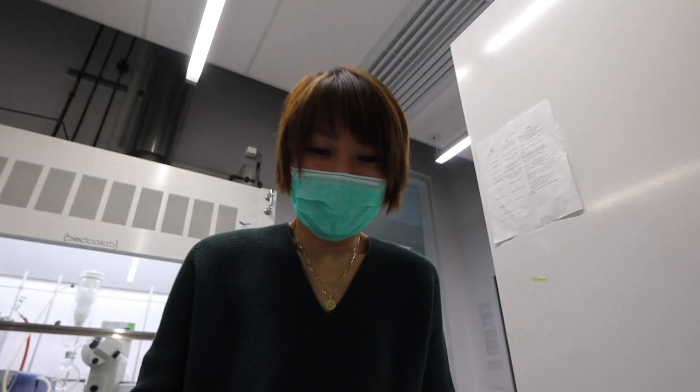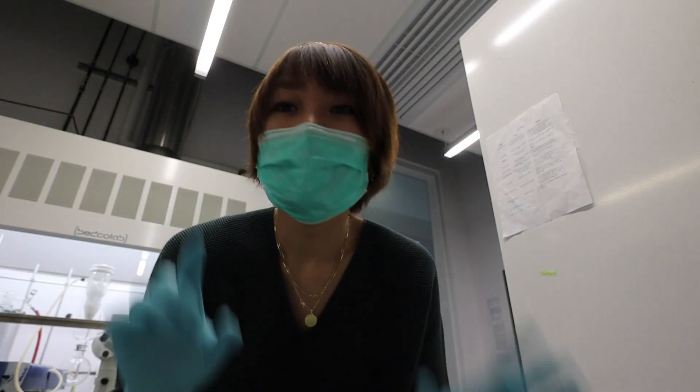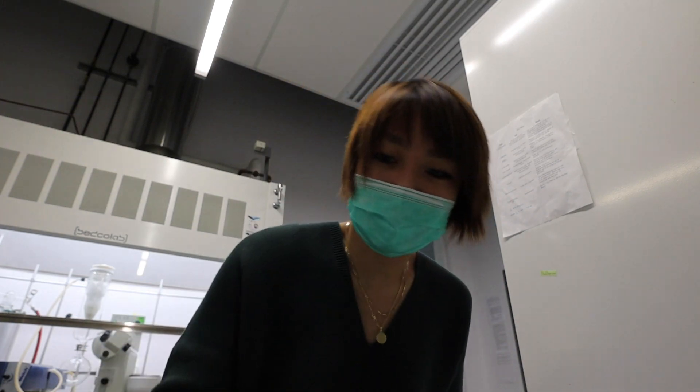I forgot another step. I think I first have to filter this. Oh my gosh, so I'm just gonna grab a cotton ball and I'll put this in there in one second.